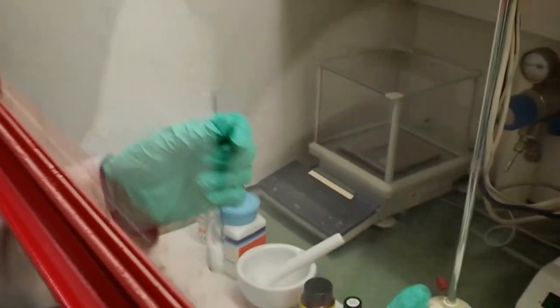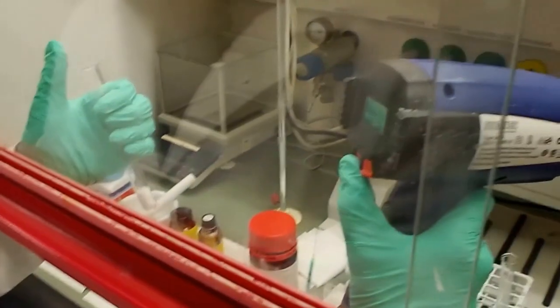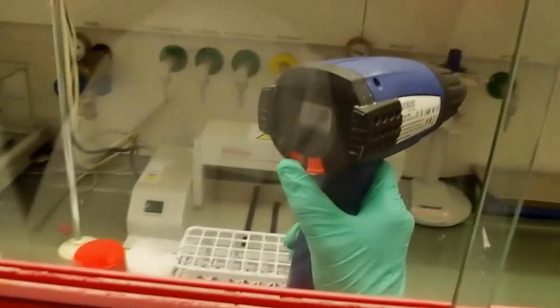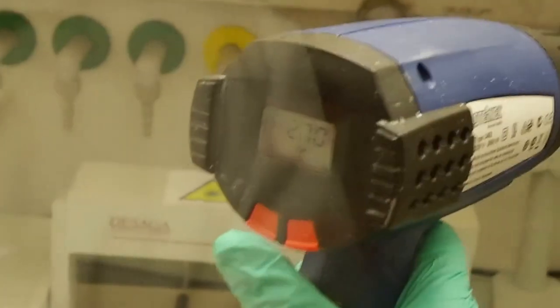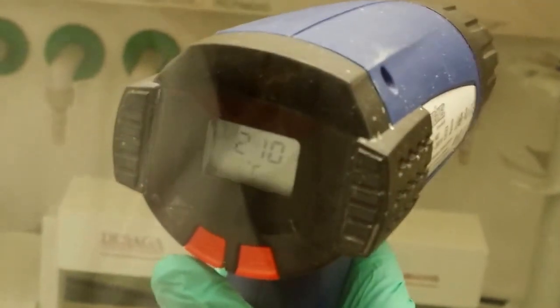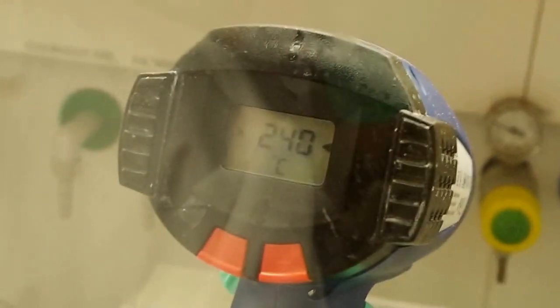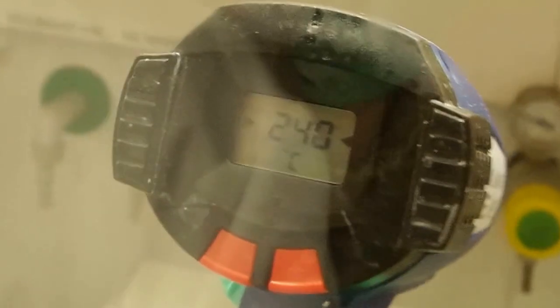But now, guys, we must control it. So let's say we set the maximum temperature to 250. Okay? You see? 230. Come on, 240. It's Friday evening. You want to go home? Or party? Okay, we have 250.